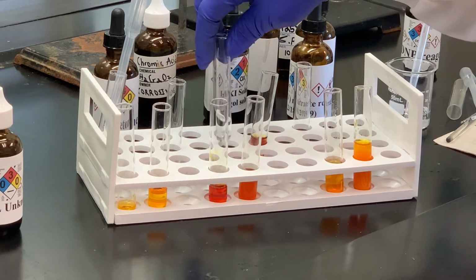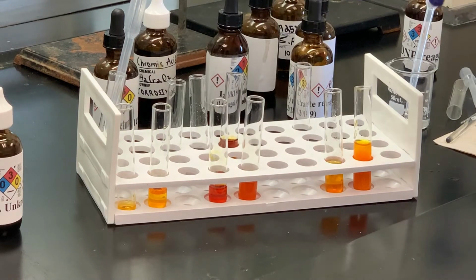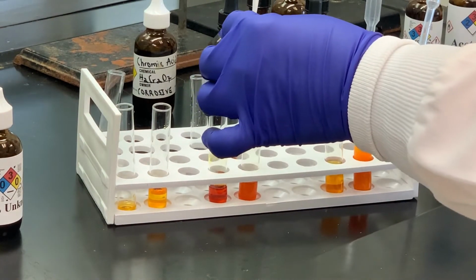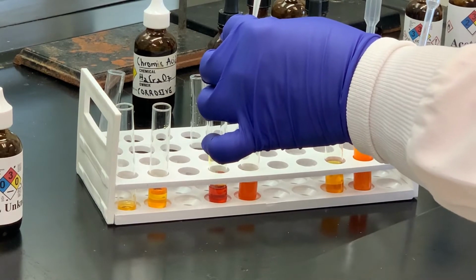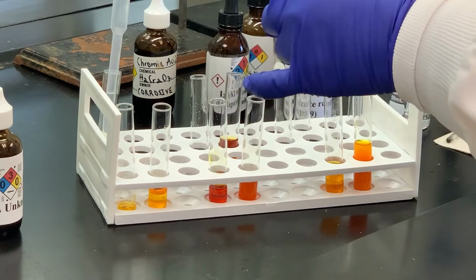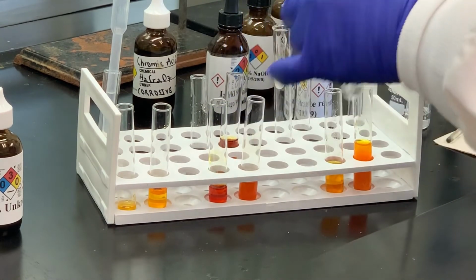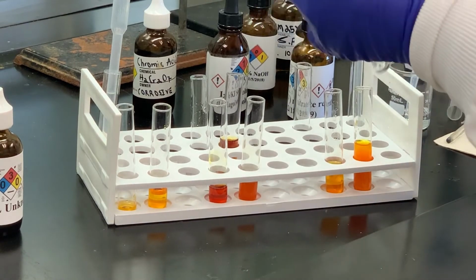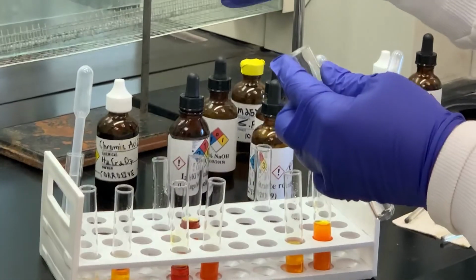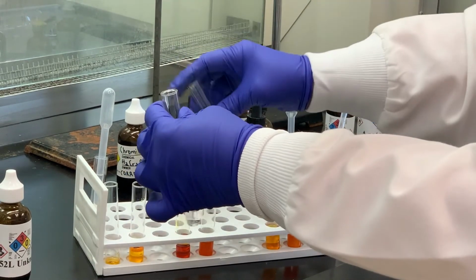We will follow that by adding some sodium hydroxide solution and then the iodoform test, and see what happens. I'm going to add some of my unknown to the aqueous solution that has another substance in it for solubility. The test tube is pretty full, so I'm going to add that mixture to the larger test tube.